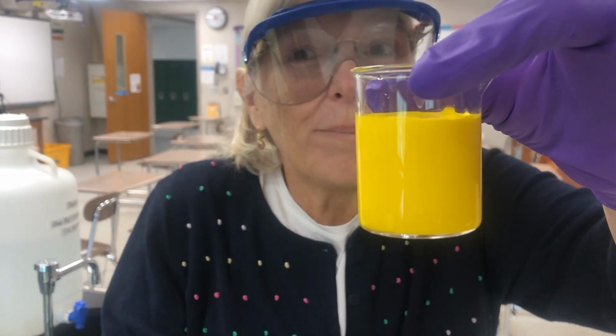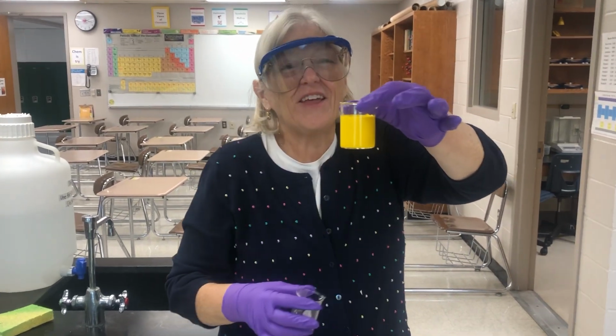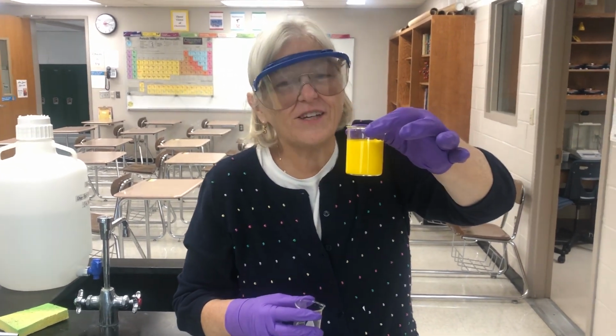Oh, sorry about that. I have something that looks like yellow paint. In fact, they no longer are allowed to make paint out of lead because this would be very poisonous. Thank you. That's the end of part A.